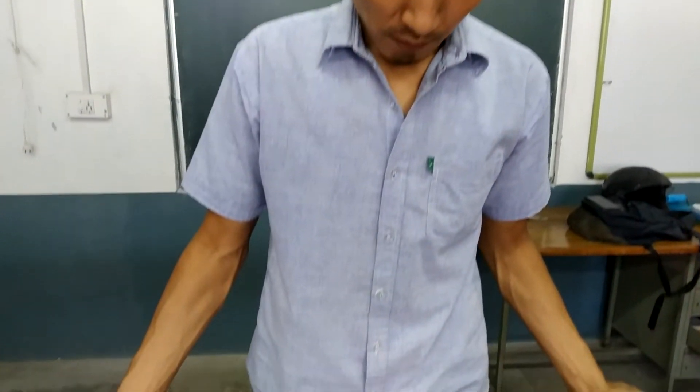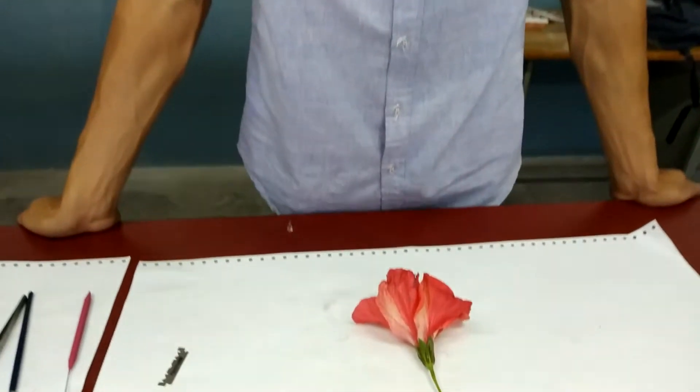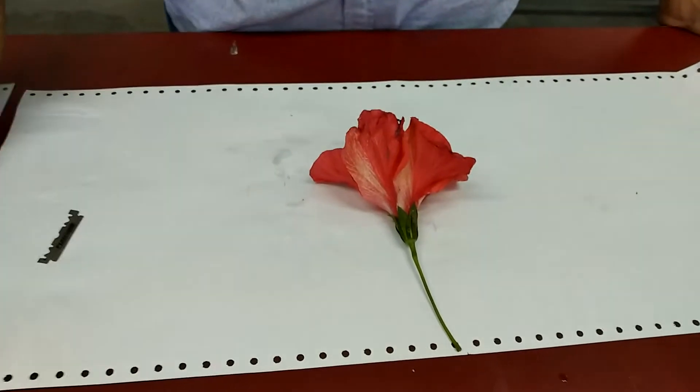The next experiment is the study of parts of the flower. The flower that has been provided today is the China rose.